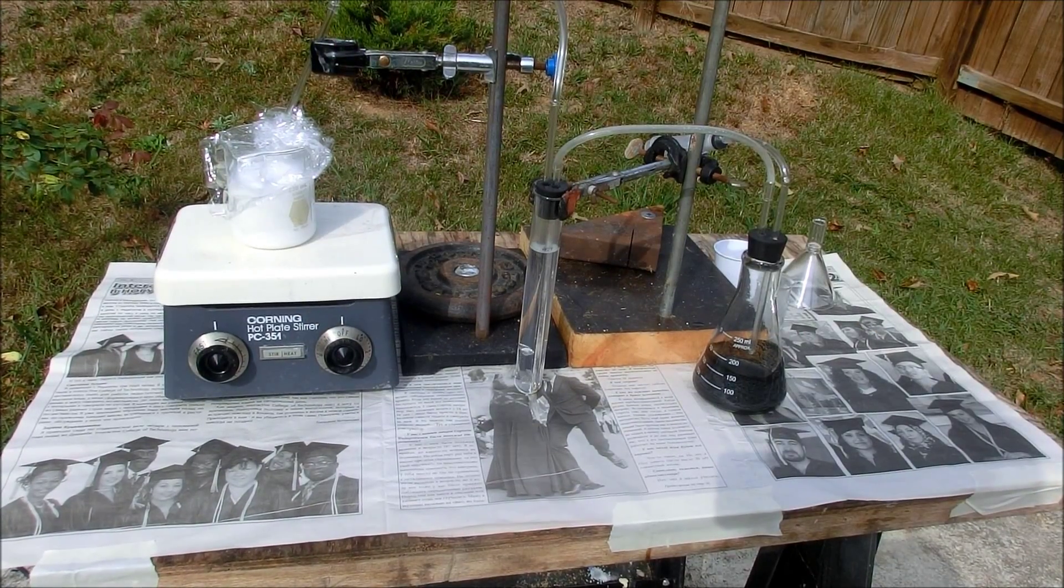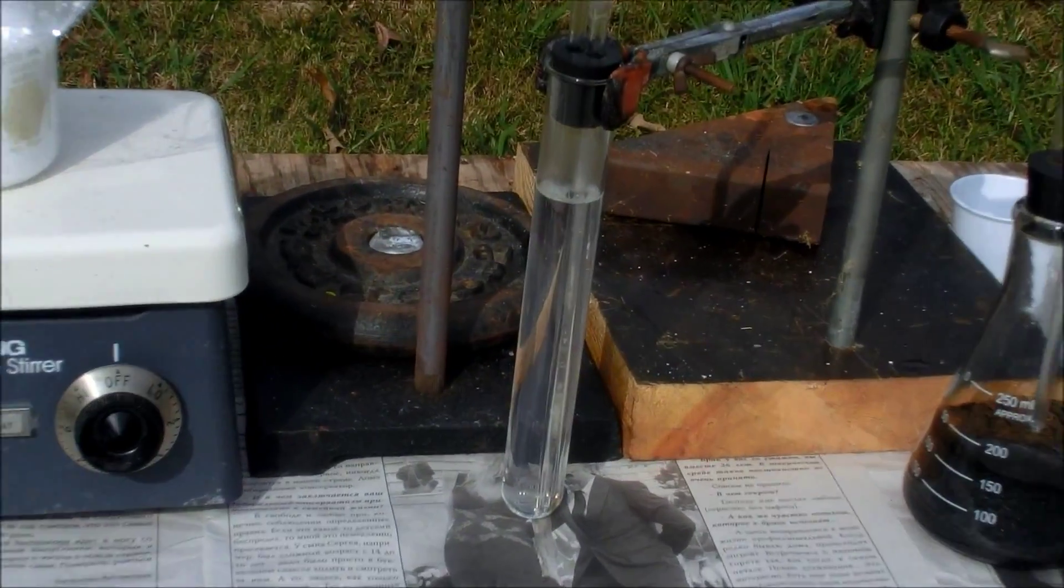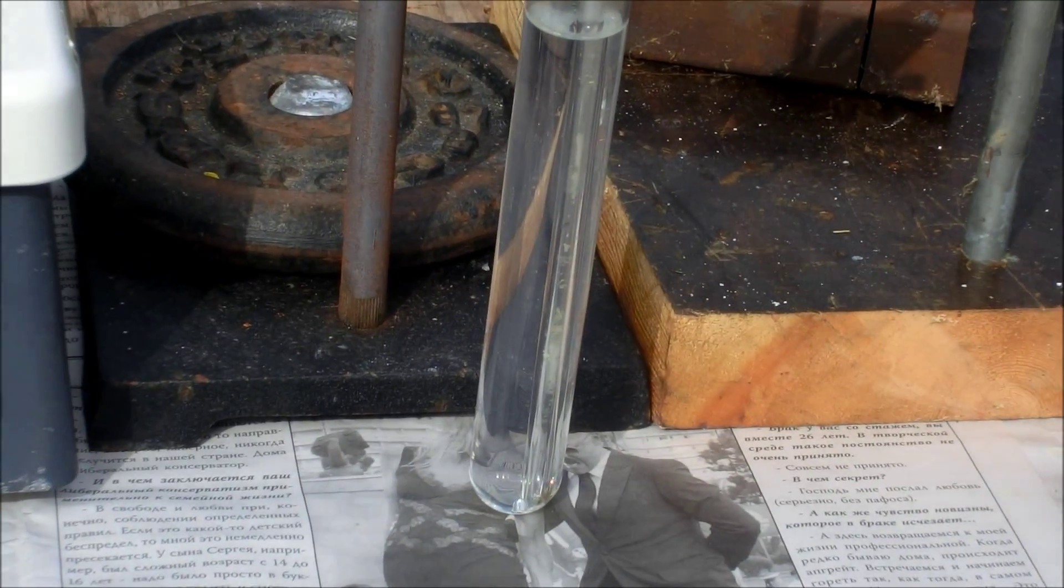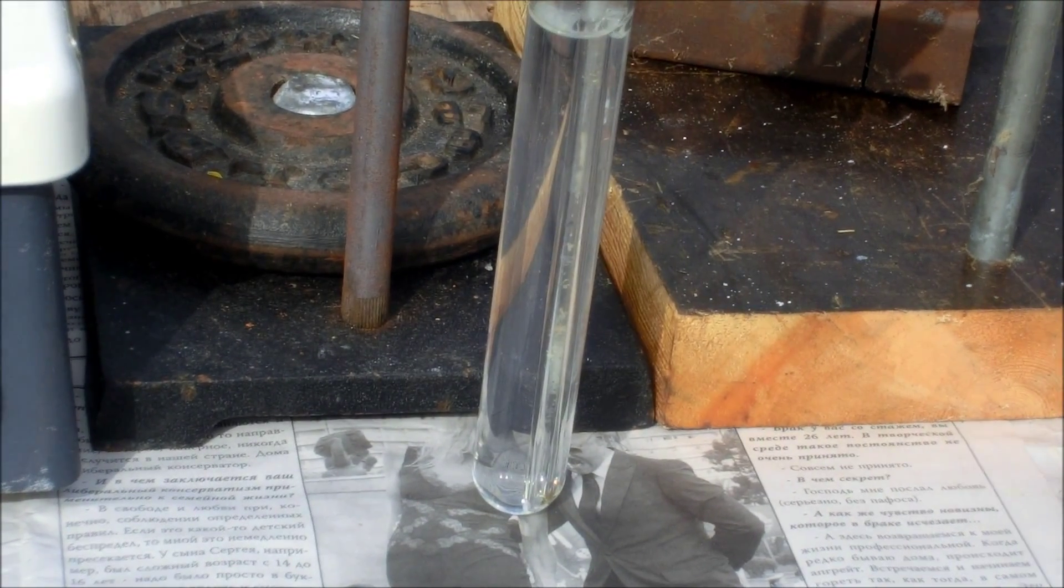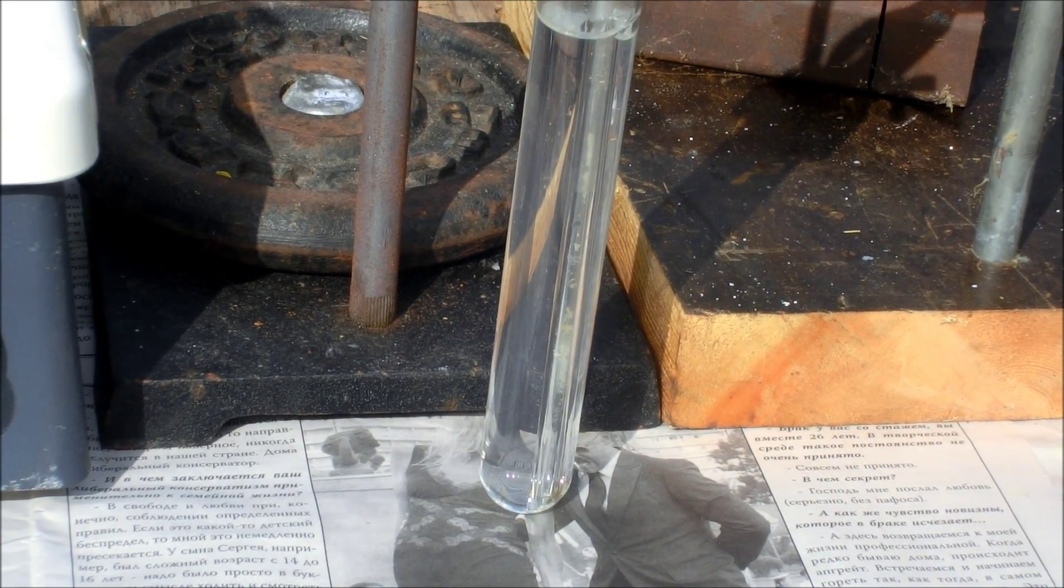It's been about 45 minutes since the start of gas production. As you can see, I'm getting a bubble every couple of seconds. I'm going to wait about 15 more minutes and then disassemble the apparatus and we'll filter the zinc sulfide from the solution.